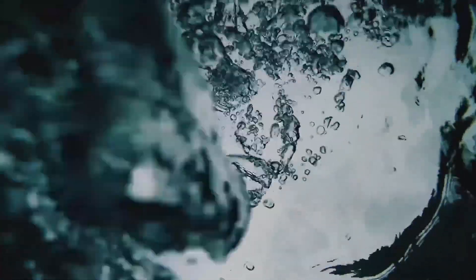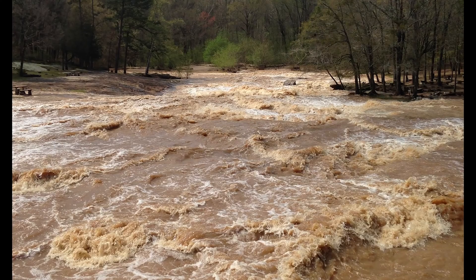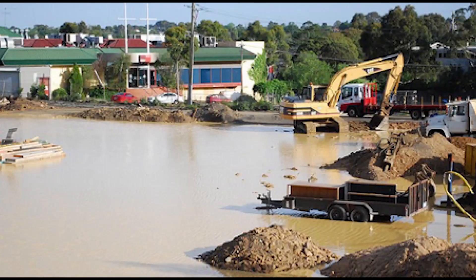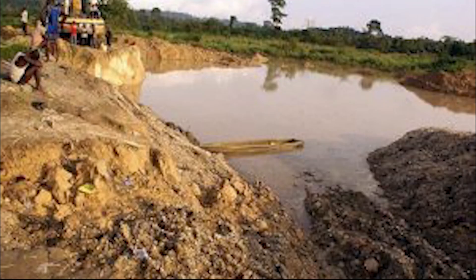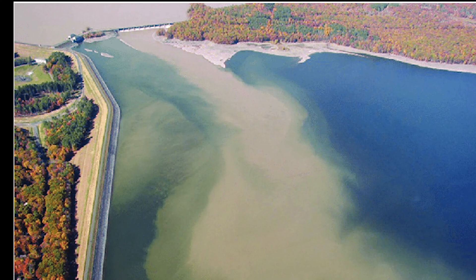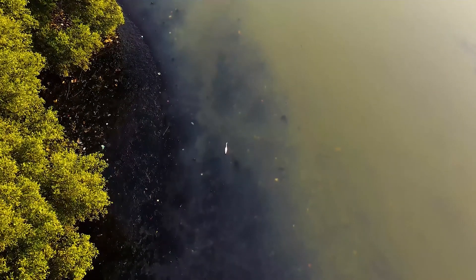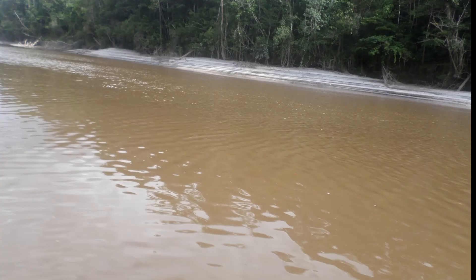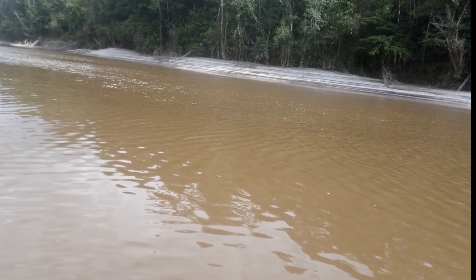Turbidity tells us how clear the water is — it is therefore the cloudiness of the water. Turbid water is caused by human activities that disturb the water, such as construction, mining, clay particles, etc. Turbidity is not the same as the color of the water, because darkly colored water can still be clear and not considered turbid.